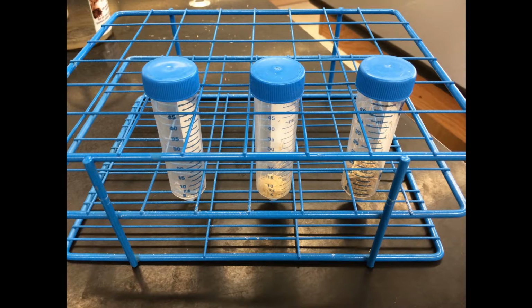With each of the chosen samples, after the grinding or cutting treatment, weigh out 1 gram of biomass, placing each into a separate 50 milliliter Falcon tube along with 1 blank sample. Label each Falcon tube with team initials, date, and sample description.